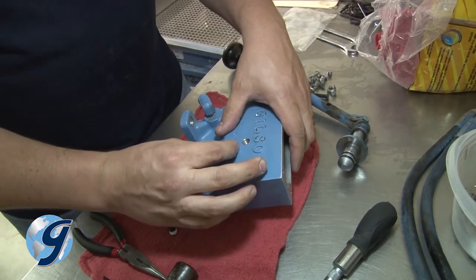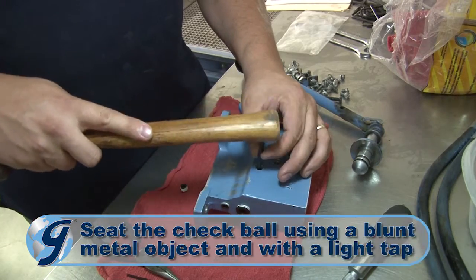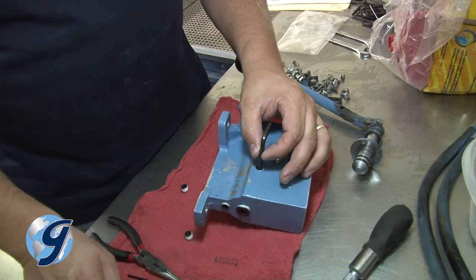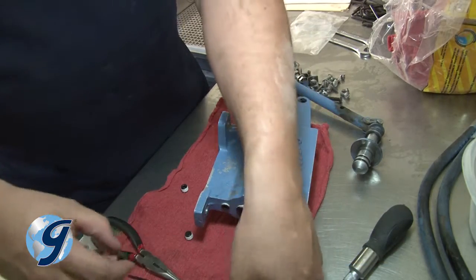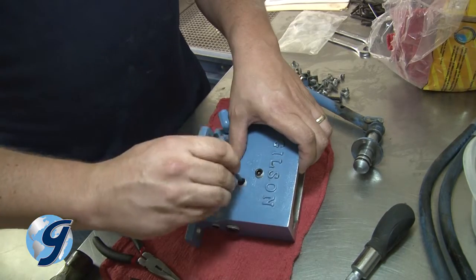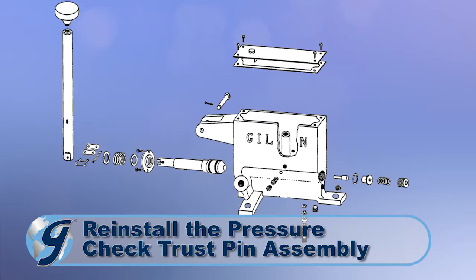Now, install the intake check ball, and using a blunt metal object with a light tap from a handle of a hammer or mallet, seat the intake check ball into place. Next, install the intake spring, the longest and thinnest spring in the repair kit, and finish with installing the new plug.